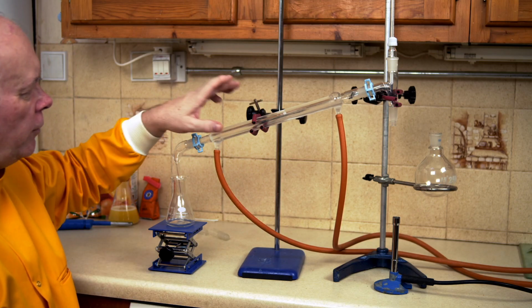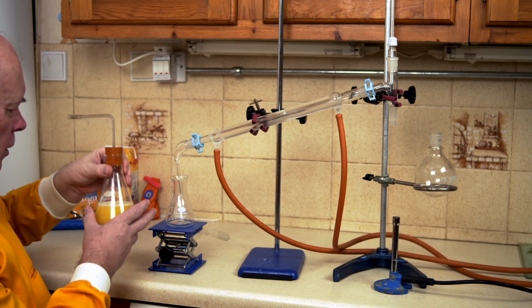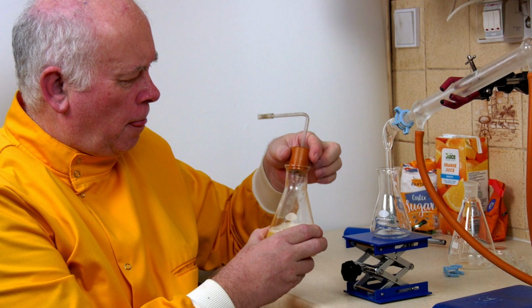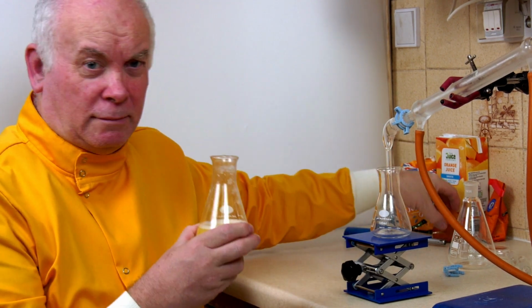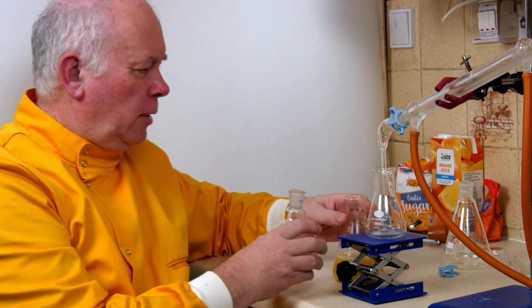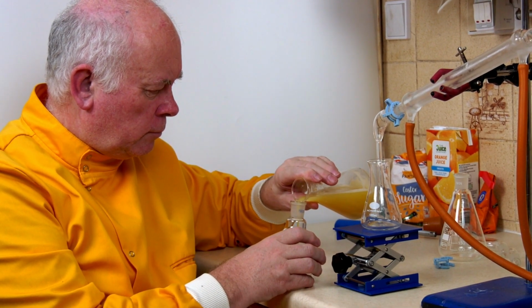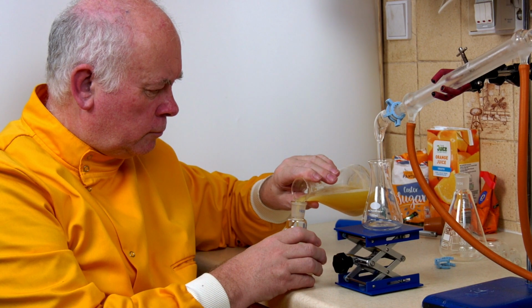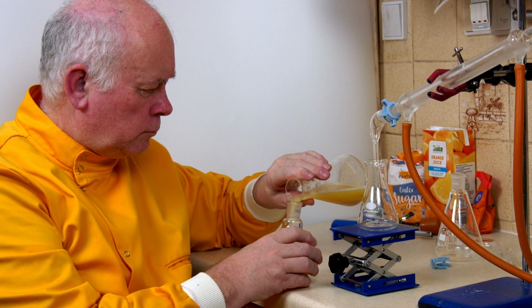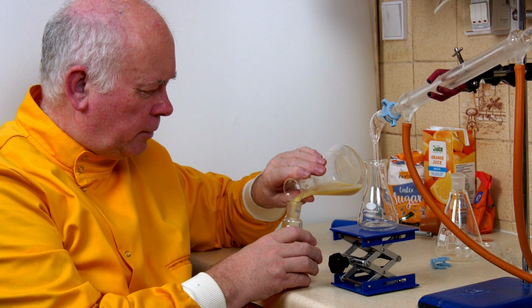Looks like we're ready to go. We've got the equipment running, everything's fine. So what I need to do is to take my orange juice that I've fermented. Has a little whiff of alcohol there, which is probably good. And what we want to do is pour some of this in there. It looks like all of it will go in quite happily.